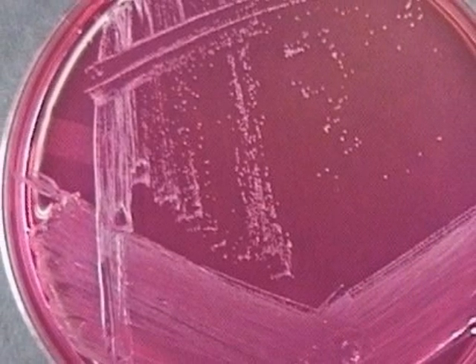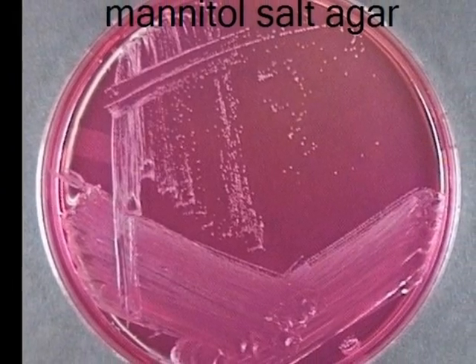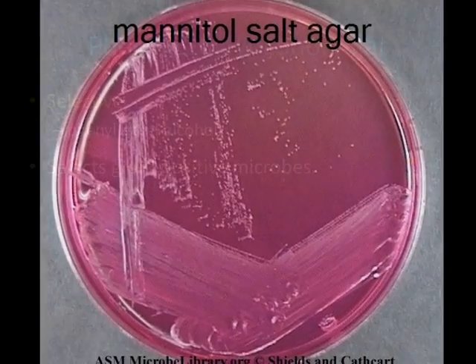Interpretation of these results on mannitol salt agar would be that the microbe tolerates the salt, but does not ferment mannitol and is most likely gram-positive. You could go further and say that it is most likely a non-aureus Staphylococcus species.